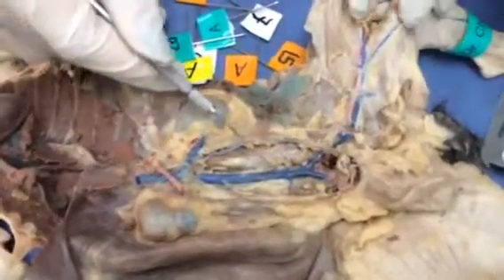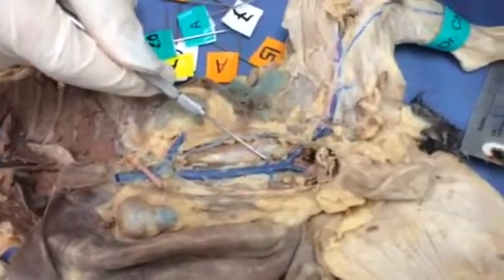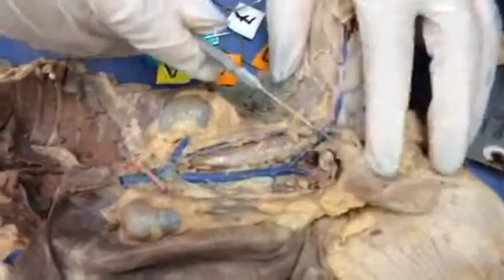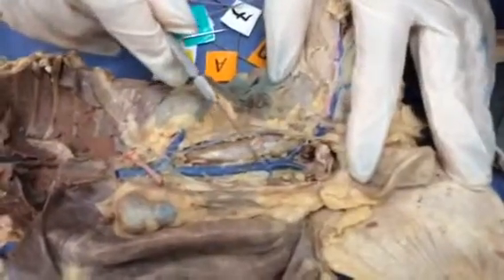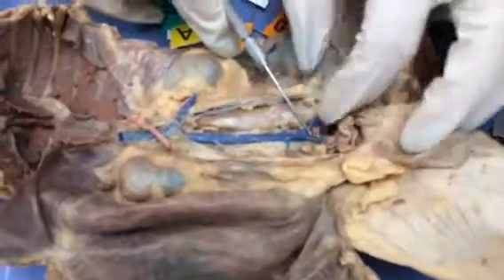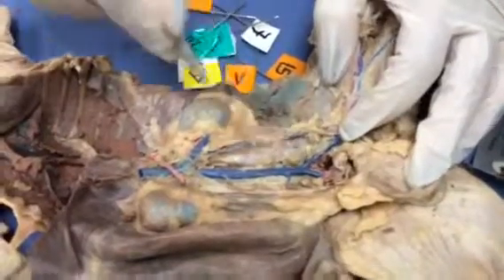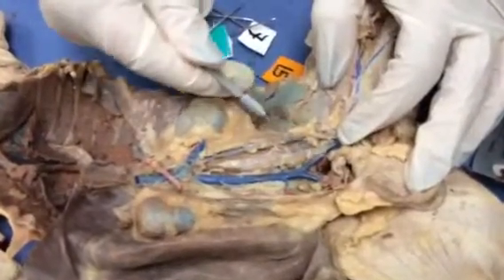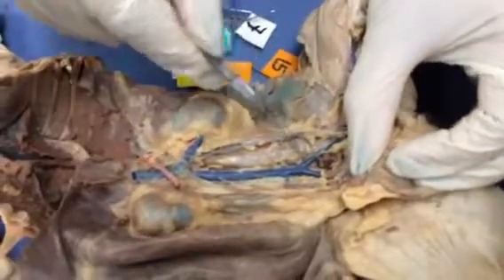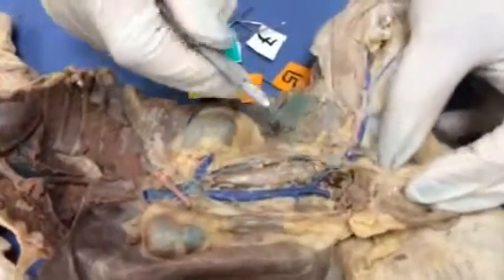We continue the journey. We follow the iliolumbar vein, the left and the right. When it bifurcates, the inferior vena cava comes into the common iliac. The common iliac gives me the external iliac. Left external iliac, right external iliac. And then the internal iliacs, which are not displayed in this specimen.